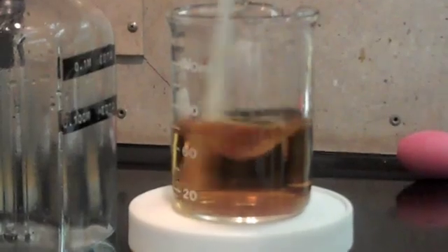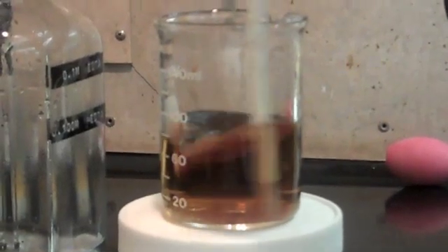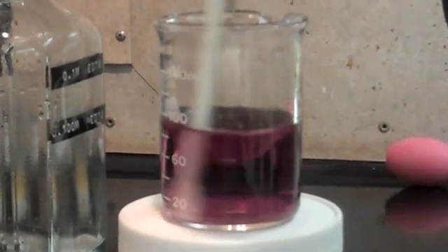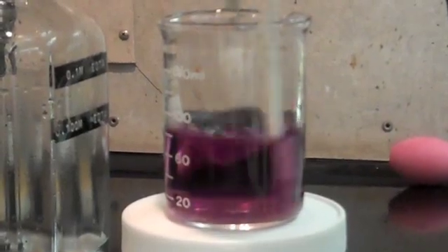Some people will stop right about here which is purple but it's not a vivid purple, so you're going to need to go just a few more drops.